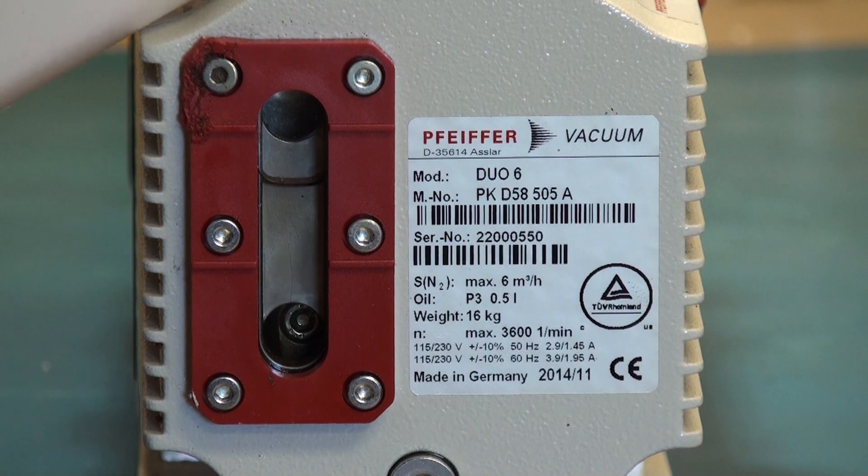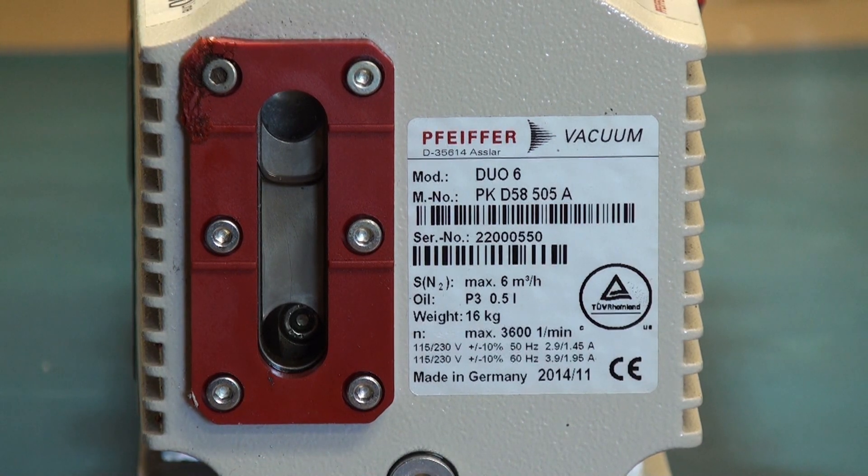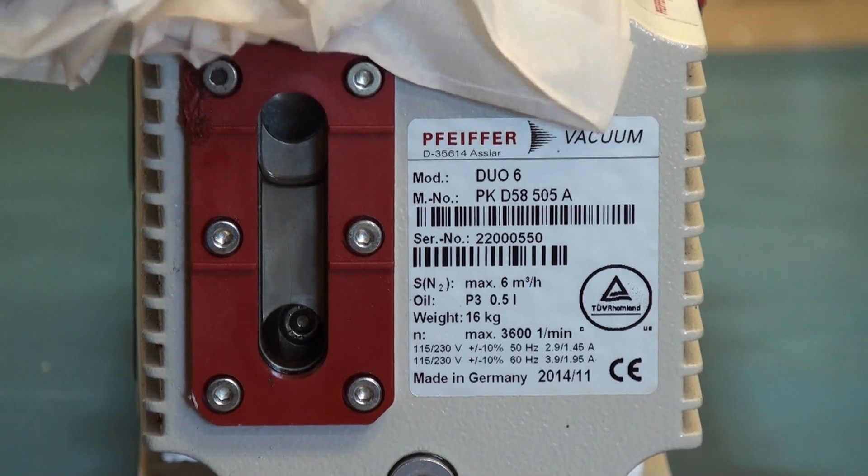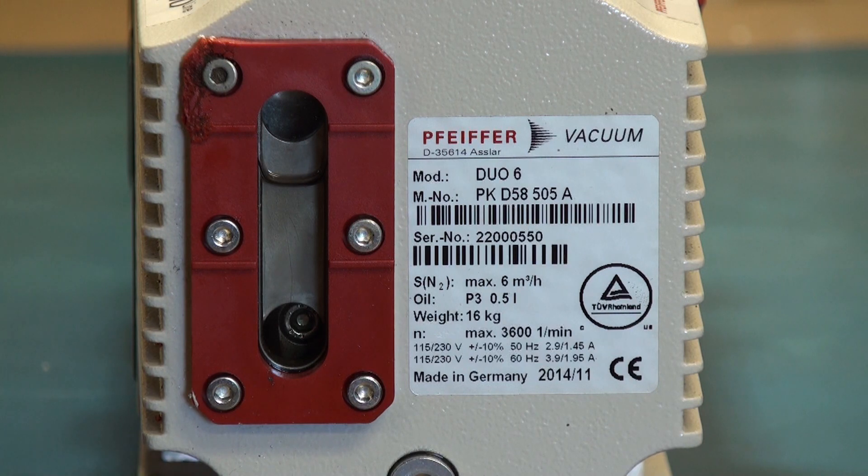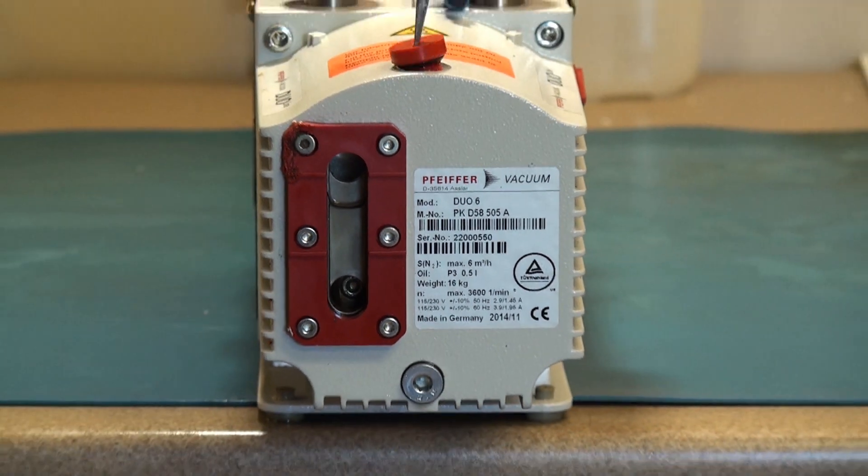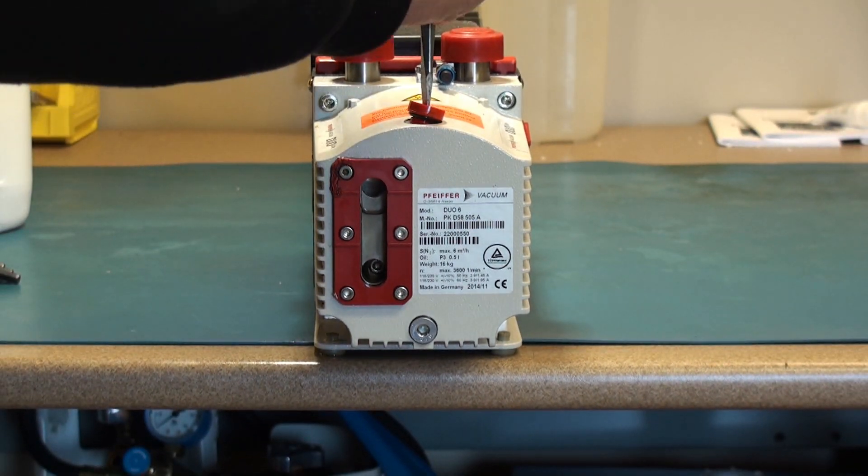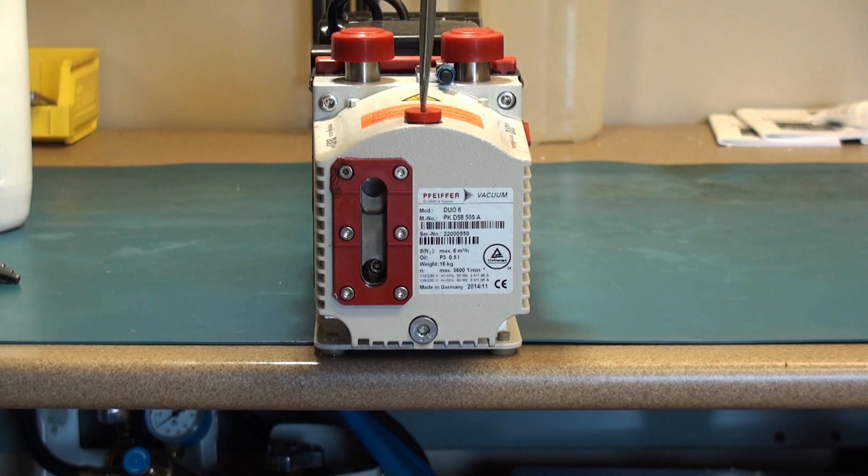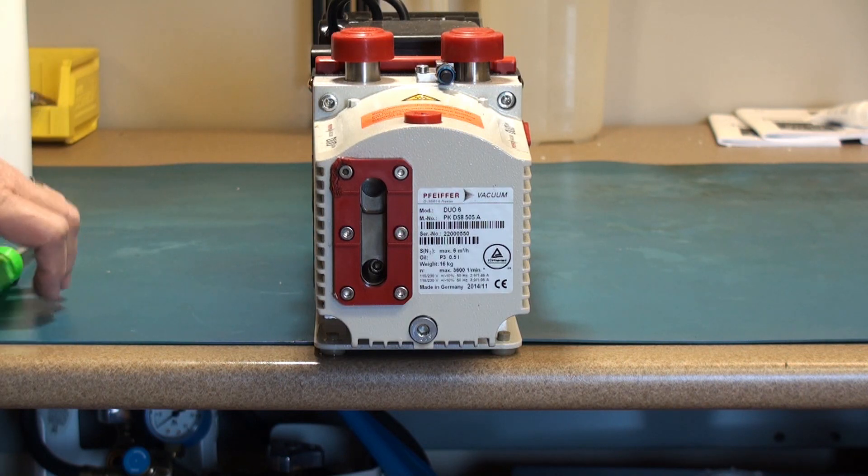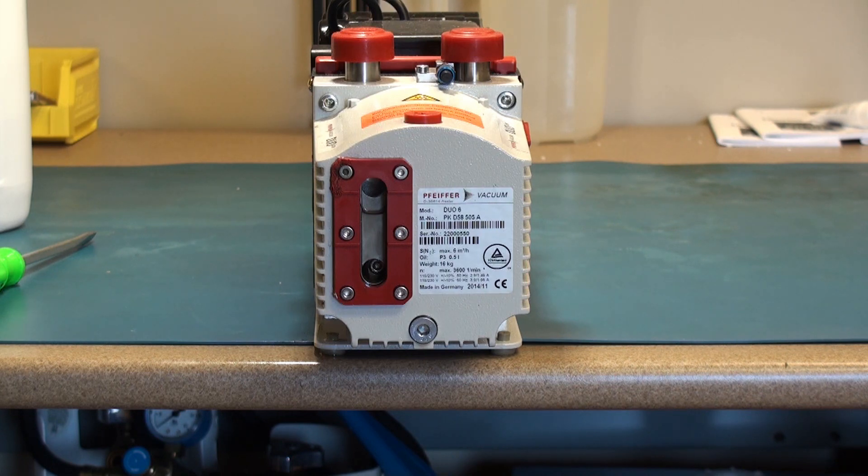When the oil warms up it will expand. So now I consider the oil level full. So I put the fill plug back in, turn it till it's tight, and that completes the oil exchange process on the Pfeiffer Duo 6.